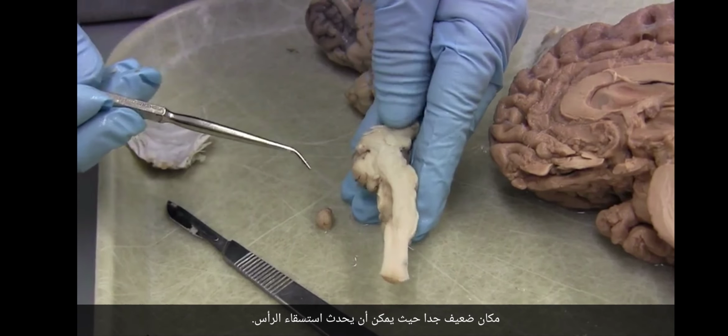And we see our friend, the hippocampus. So all I've done is I made one little cut to reveal. I'm going to have to make a little bit more of a cut just so that you can see it. We'll take a little bit off of here.